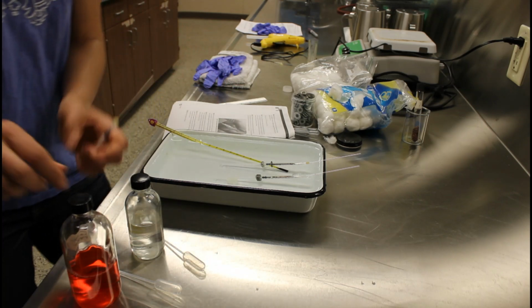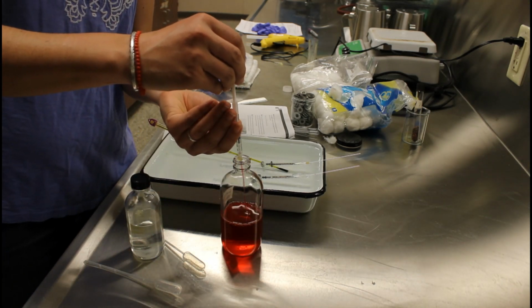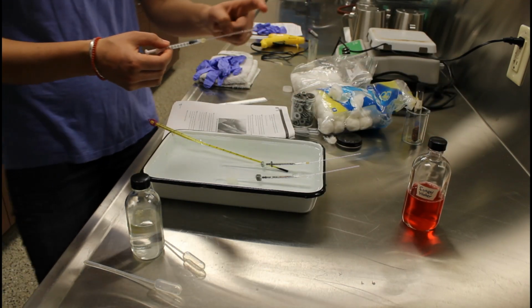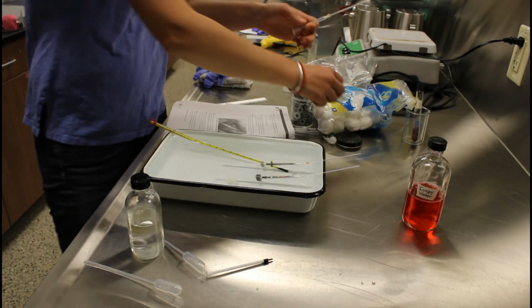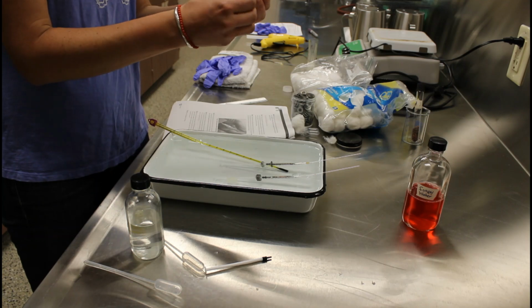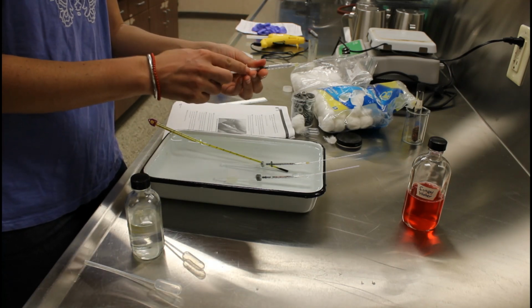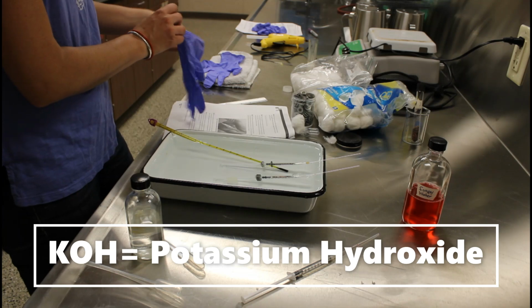So I'm just going to start by getting this thing a little bit wet and a little bit soapy. This is just soapy water with red food coloring. So now the capillary tube is kind of like lubed up. Then I'm going to put a little bit of absorbent cotton inside the barrel of the syringe. I'm just going to put a tiny little ball in there and then poke it down with the plunger. I'm doing this because I need a little bit of KOH inside my micro respirometer.